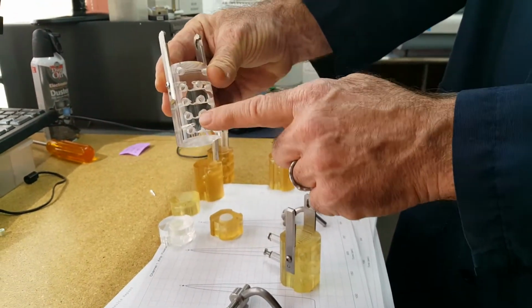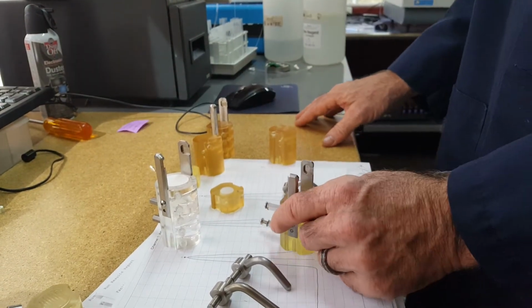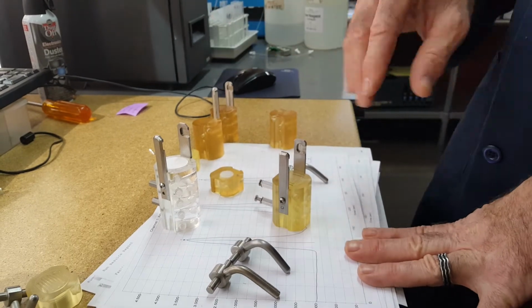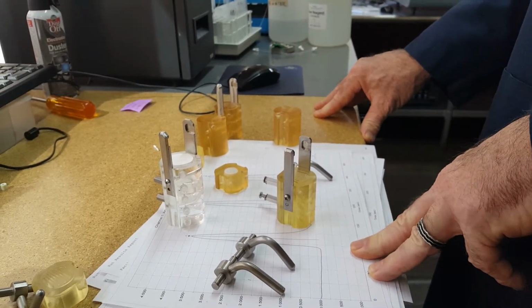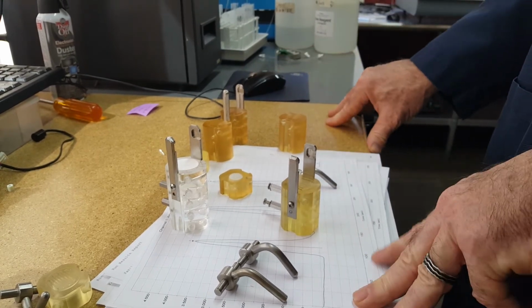Of course, the acrylic module has all of the mixed T's on it. All of these are pretty much going to do the same thing, just with different applications. So if you have any questions about the different aspects of how they can be used, be sure and let us know.